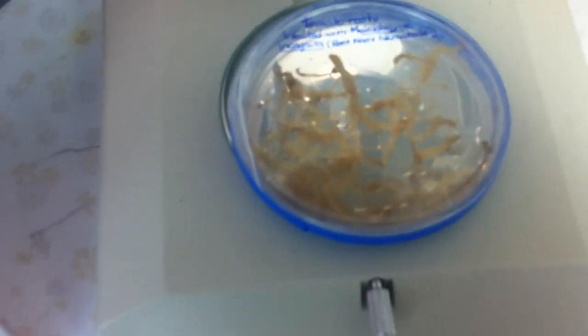Now they're going to be able to contrast this with a couple of petri dishes with pre-labeled roots. Here, pardon me for a second, but this is a tomato root that has not been infected. There we go, you can see it better here. And you can see it looks healthy, very thin, very consistent thickness. But if we go to a tomato root that has been infected, the contrast is apparent. Again, the cankers are forming there as a result of the nematodes infecting the site.